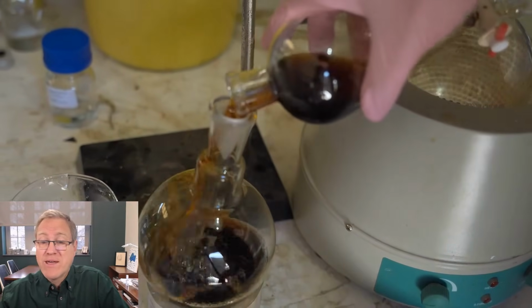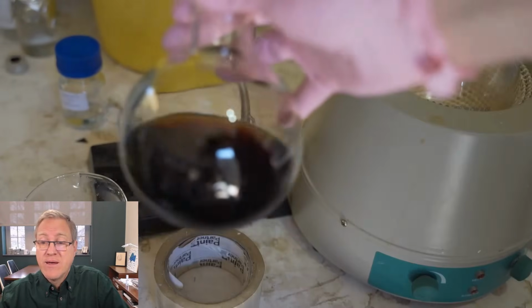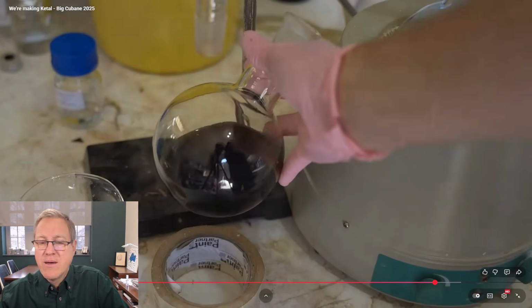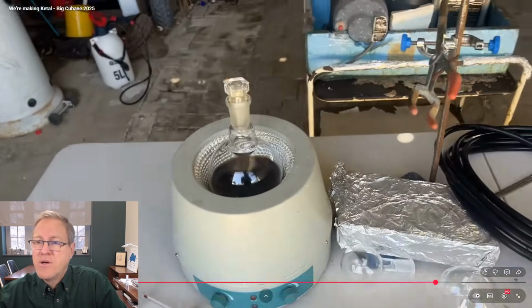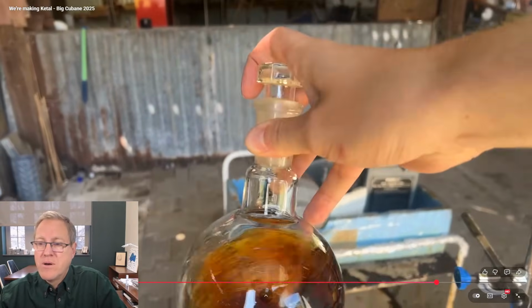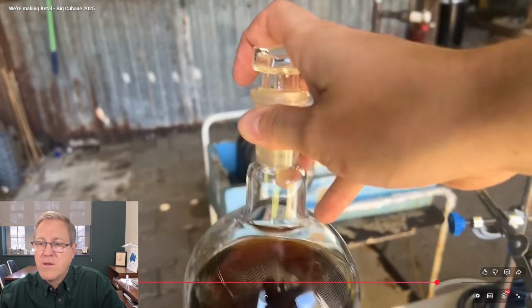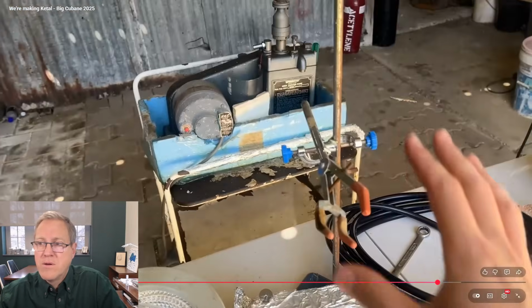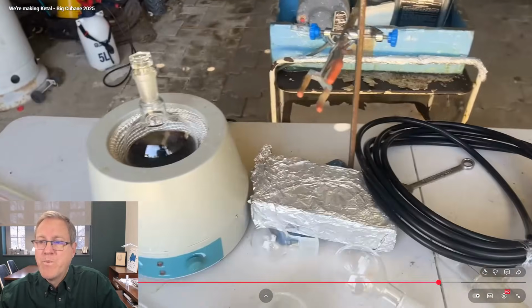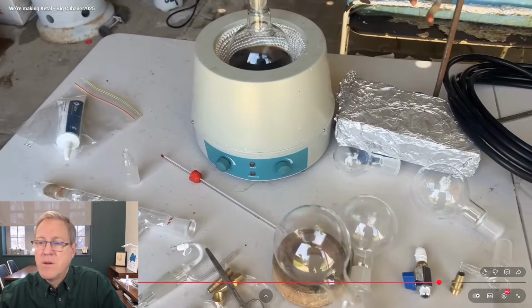Okay, he's going to dump it all back in a flask. And boom, I think... All right, we have arrived at the vacuum distillation. So we have our mixture here. We've obviously washed it. It's just, hopefully, mostly the ketal, which is what we want. But we have to do the vacuum distillation. It's probably one of the more technical things we have to do in this whole series. I'm really not set up for it and haven't done one in a while.